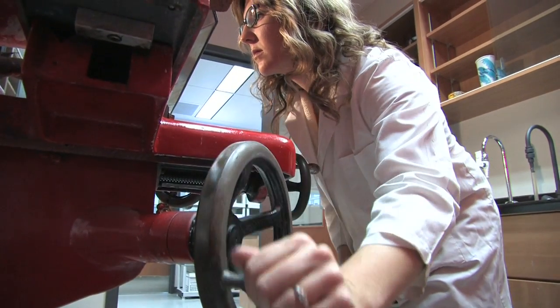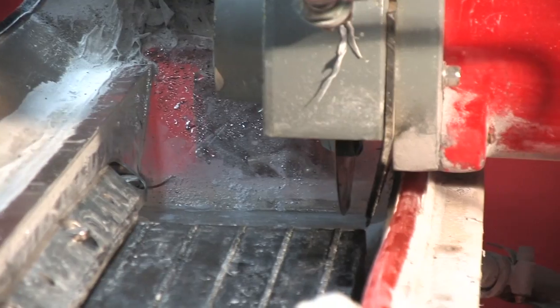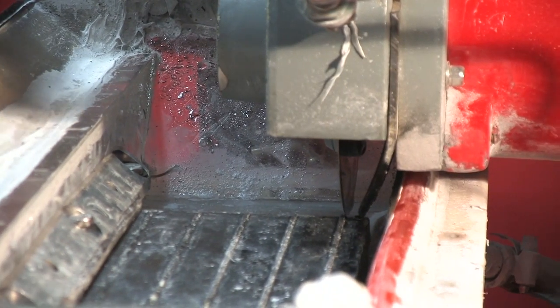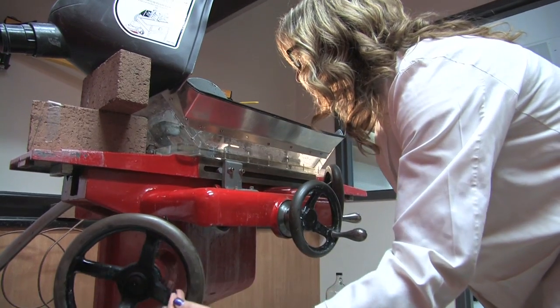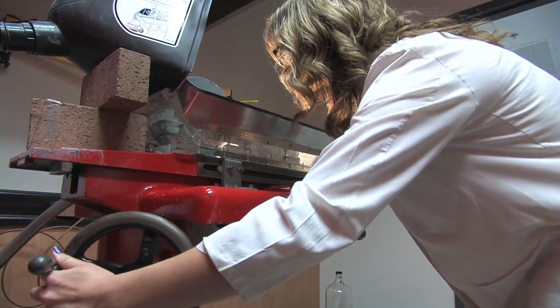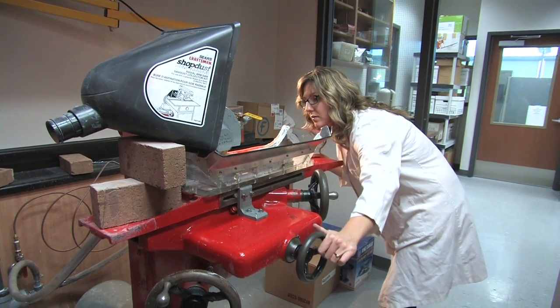Because the core of each otolith lies beneath the ridges, adjust the bed of the saw so that the distal edge or the furthest edge of the first ridge is aligned with the blade. This is done by eye by adjusting the vertical and lateral control wheels.